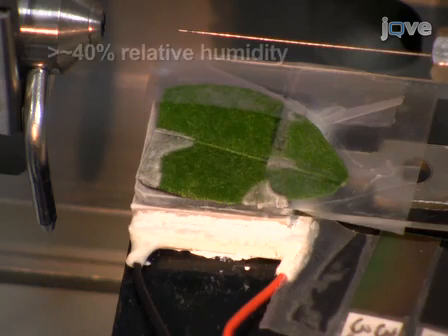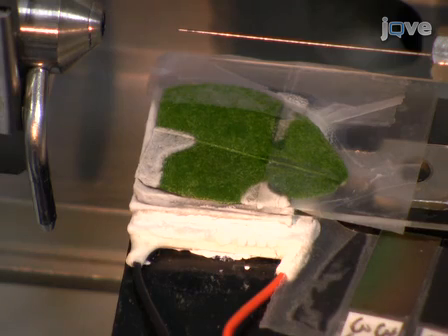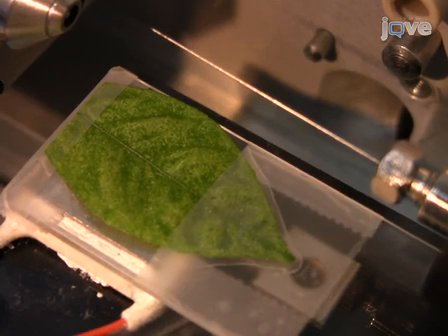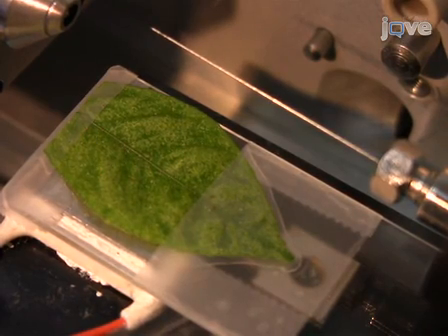Then, if working in a humid environment over an extended period of time, for about 1 to 2 hours, inspect for condensation of water or ice on the tissue surface. Water condensation on the tissue detrimentally affects the imaging performance in LAESI experiments. If needed, use a room dehumidifier or place the cooled sample in an environmental chamber filled with an inert gas, such as dry nitrogen gas, to prevent condensation. After optimizing the conditions for maintaining the sample, work to optimize the ion source used.